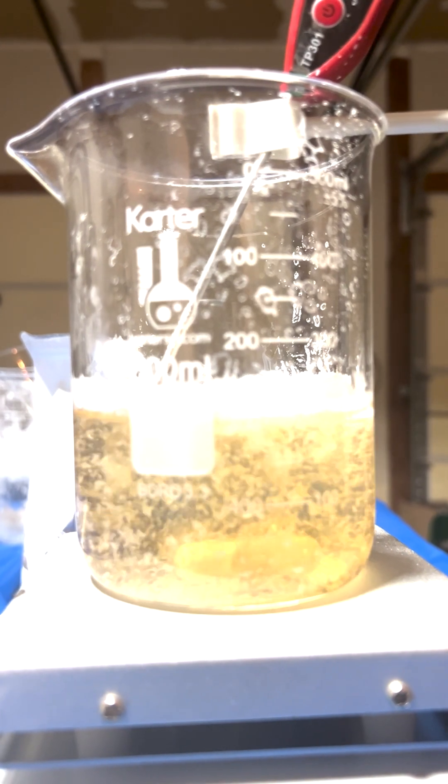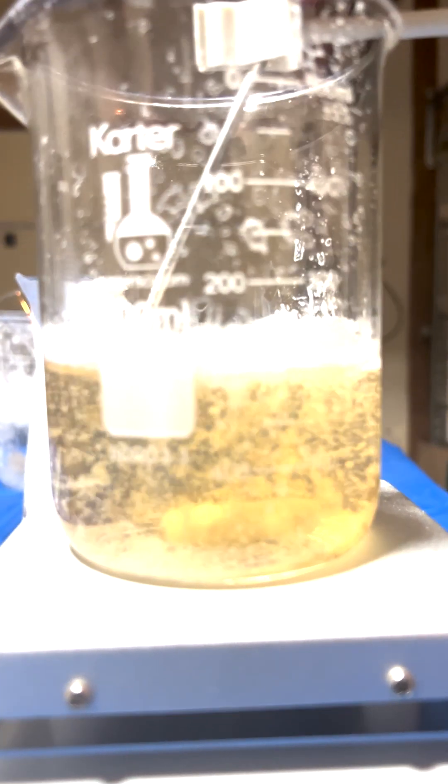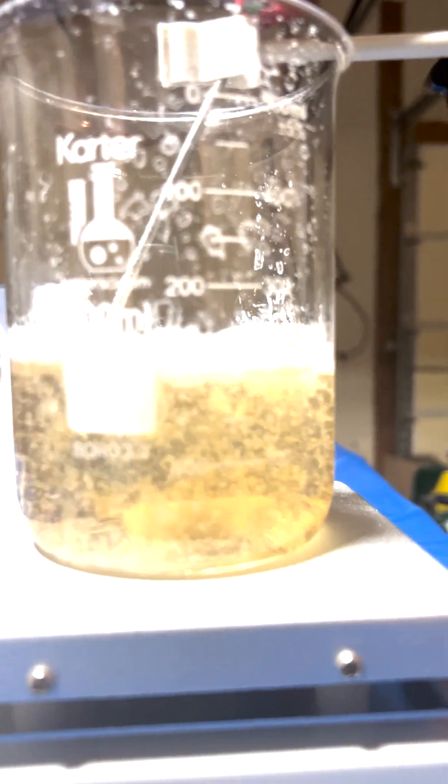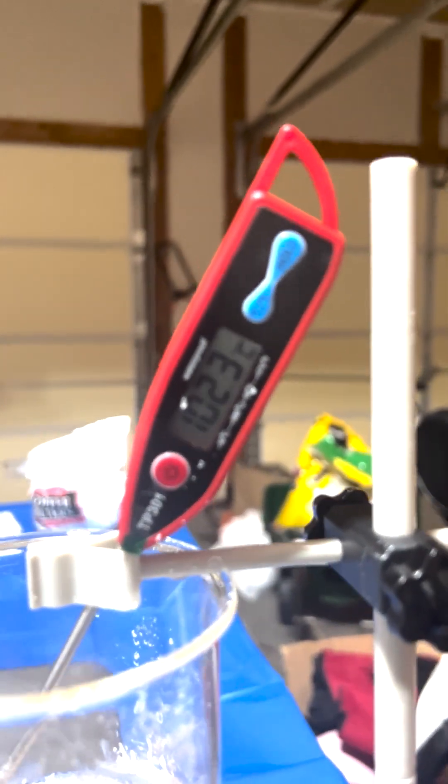Right, so as we can see here, it's been about maybe 20 minutes since the last check-in, and the crystals are starting to form now. They're much larger, you can see them from up top. We're at 102.3 degrees Celsius now. Flakes are forming.